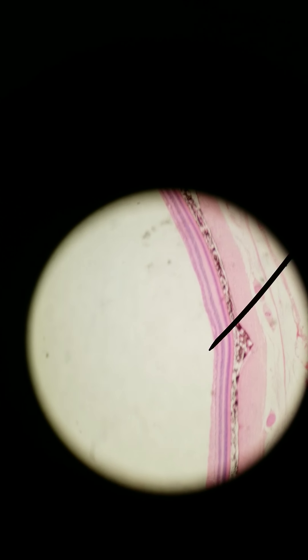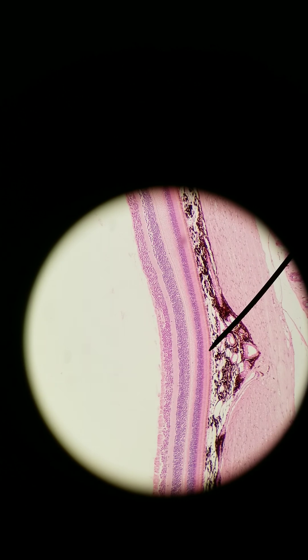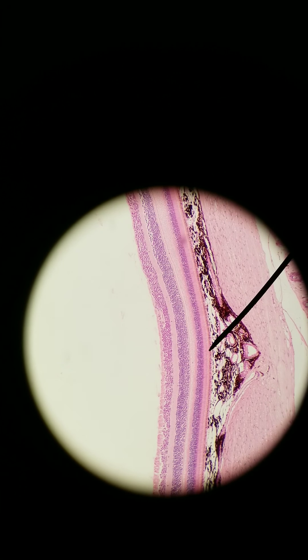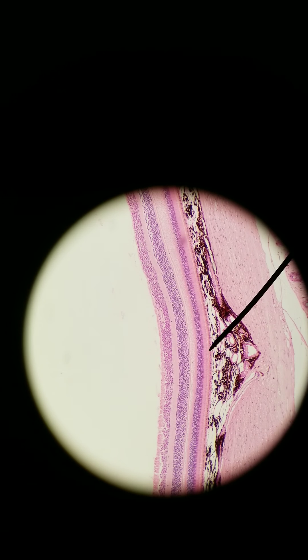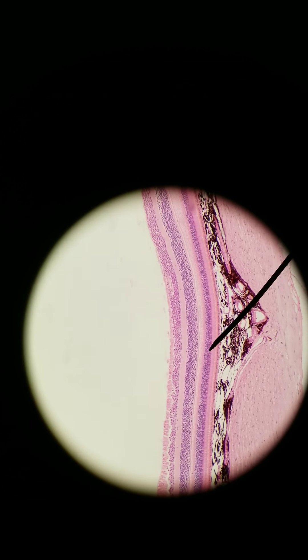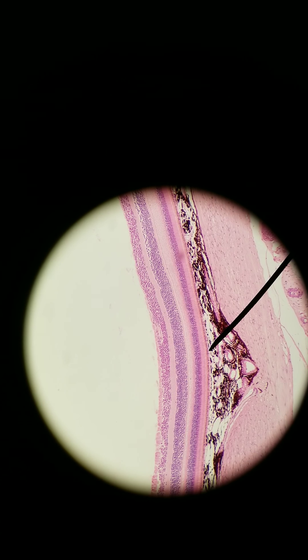We're at 40x right now. Let's go to 100x. The eye, of course, is for vision. For us to see things, we need to have some kind of stimulus. The stimulus for vision is light. So we need special receptors to detect light. In the previous video, we saw olfactory sensory neurons that detected chemicals for smell — those are chemoreceptors. These are photoreceptors. Right now what I'm pointing at, you can see the darker nuclei here. These are photoreceptors. How do I know? Because I've learned about the organization of the eye and that's what you're going to learn right now.